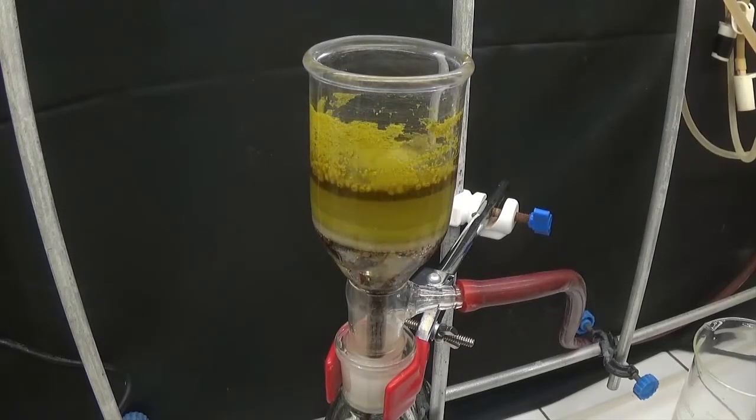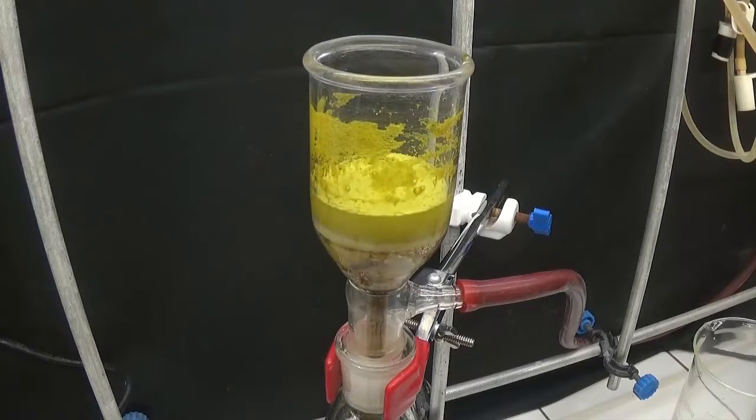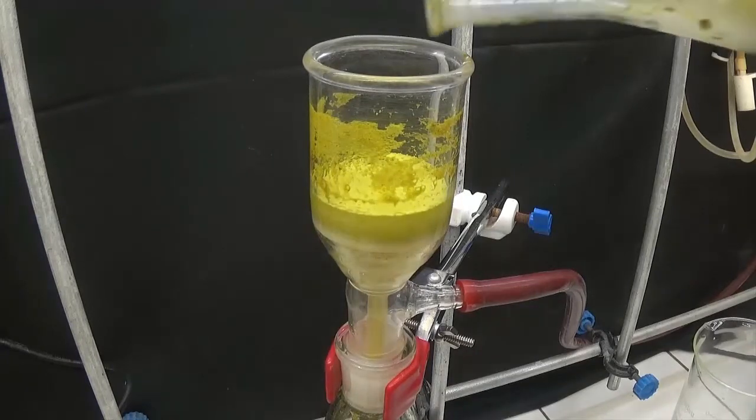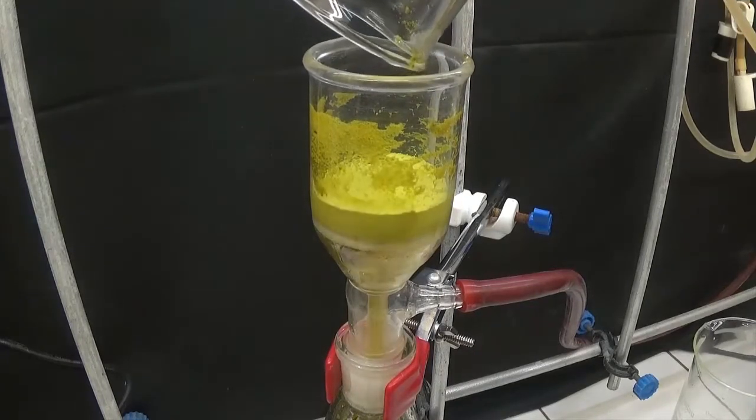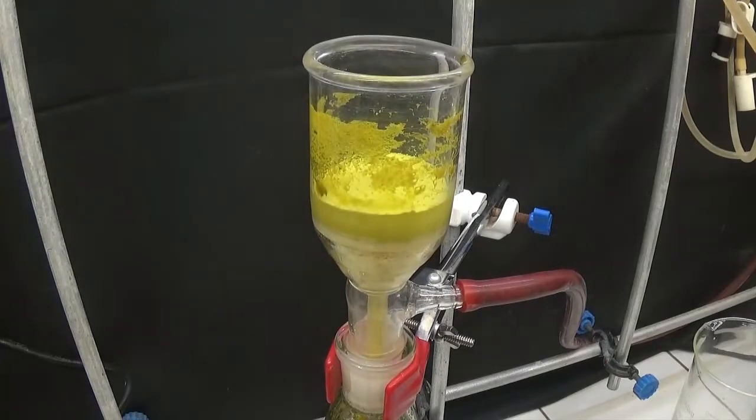Benzoquinone is a solid yellow crystal. Benzoquinone can be purified through sublimation. That obtained is already pure enough to be used as is.